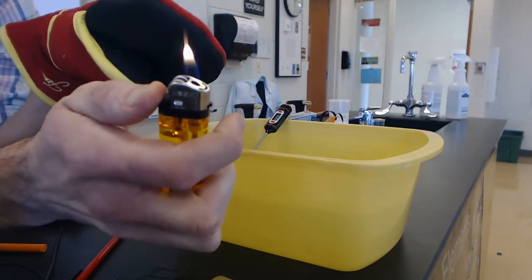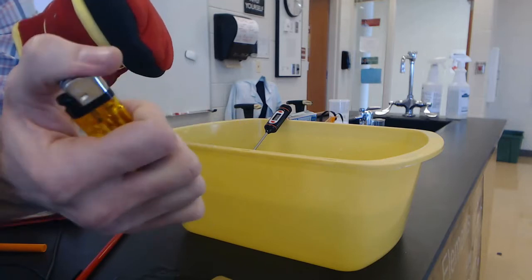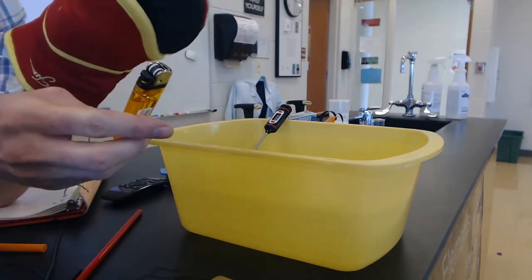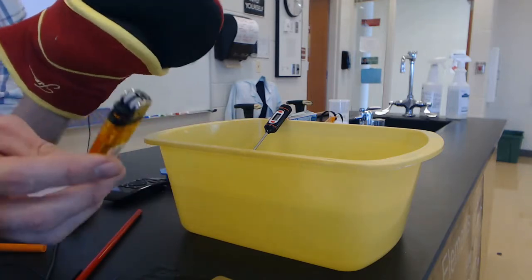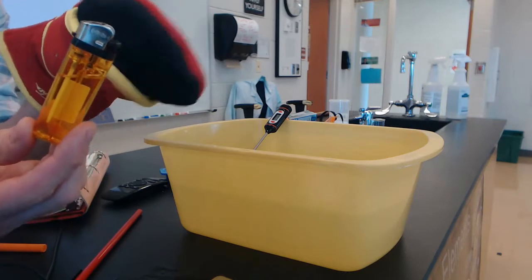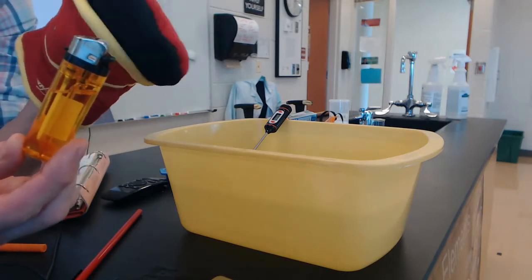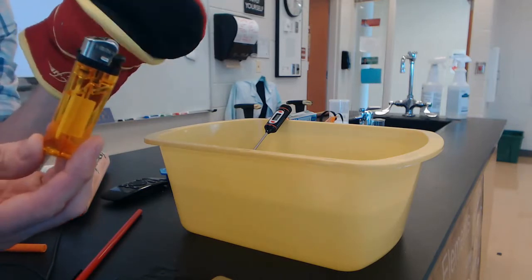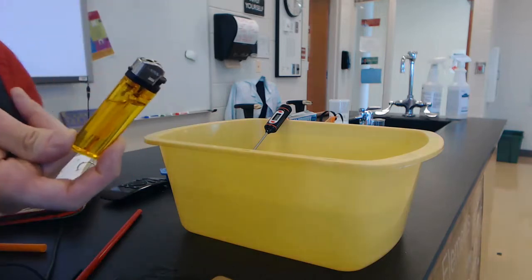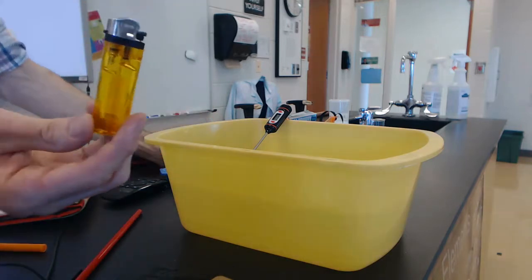We're going to do a quick video lab on finding the molar mass of butane using the ideal gas law. Make sure that you jot down all of the important information that you will be seeing in here.